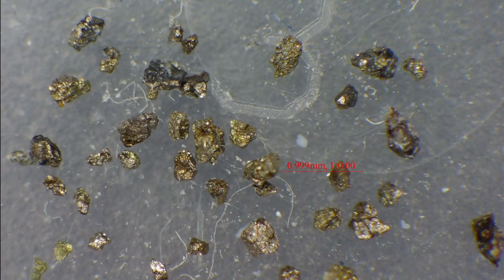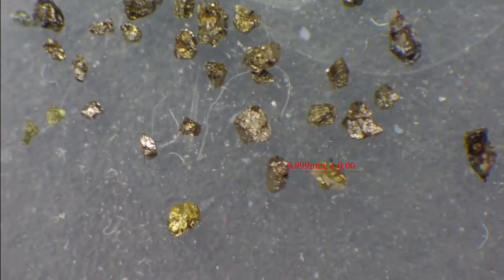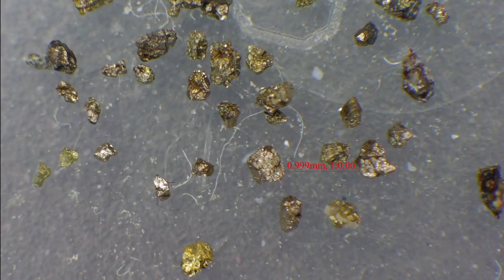Sorry, I had a call from our partner, and also I've tried to unite the fractions in one product. So I also tried to move all grains in one spot to show you on our digital microscope, but still they are not in one image, but we can see that we have at least three different mineral species.